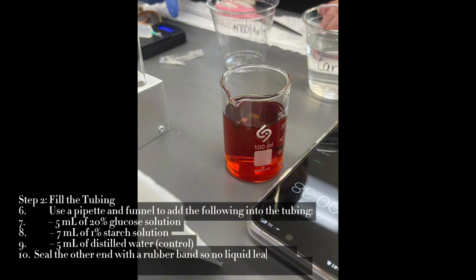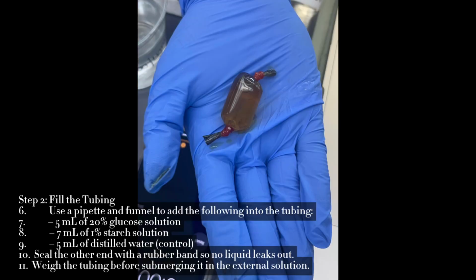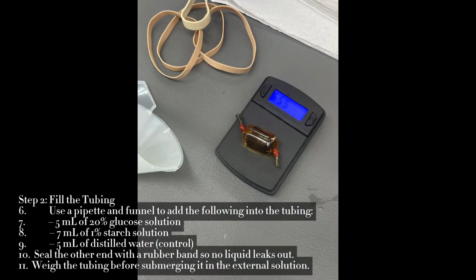Step 2, setting up the dialysis tubing using tweezers. We carefully opened the tubing and tied one end with a rubber band to create a small pouch.